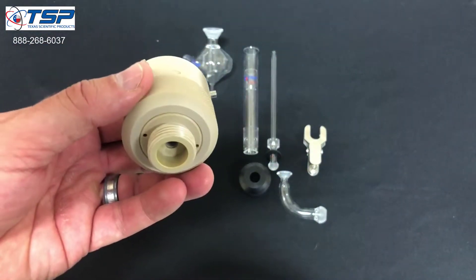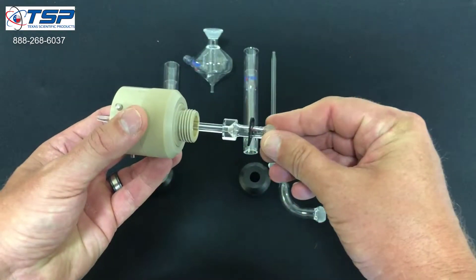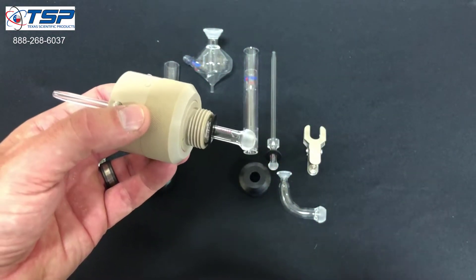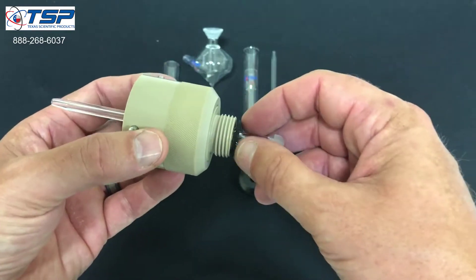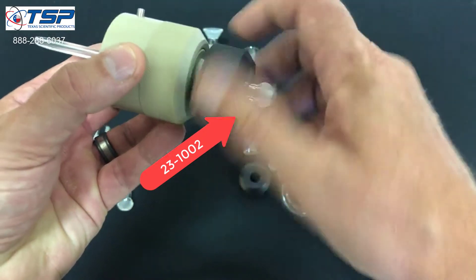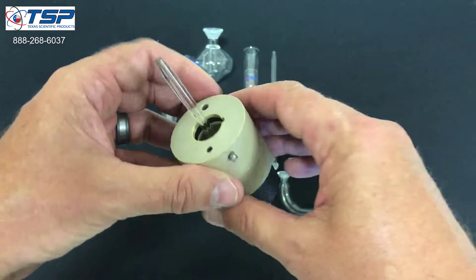We will, however, be using this. The first step in the process is to take the injector and insert it into the hole — it slides right in. Depending on your adapter, you might feel a little more or less friction as you're sliding it in. It shouldn't be so hard that you feel like you're going to crack it, but also not so loose that things are wobbling around. If either of those cases exist, call Texas Scientific and we'll get you squared away. Once the injector's in there, we'll take the new black nut and screw that down nice and tight.